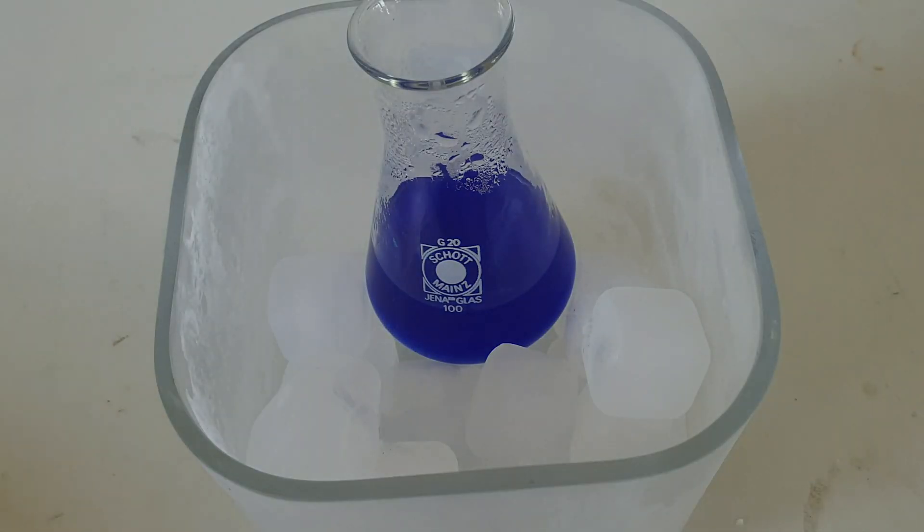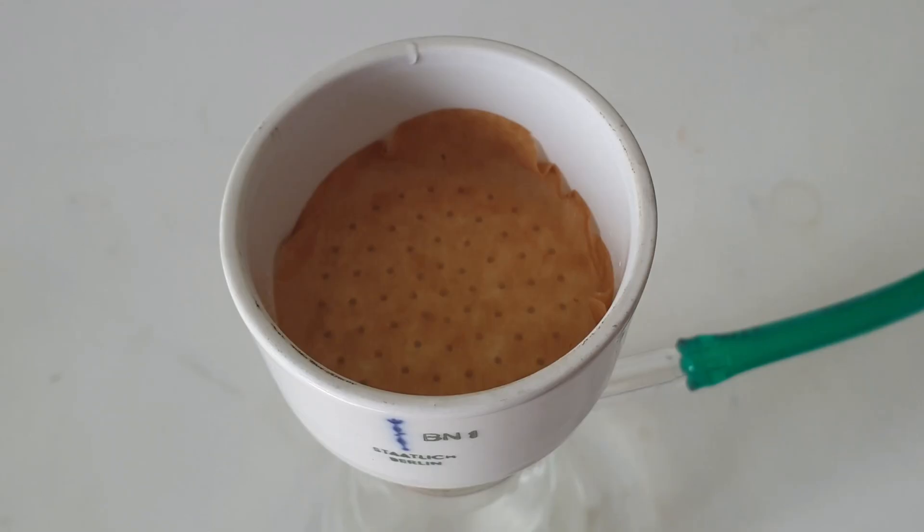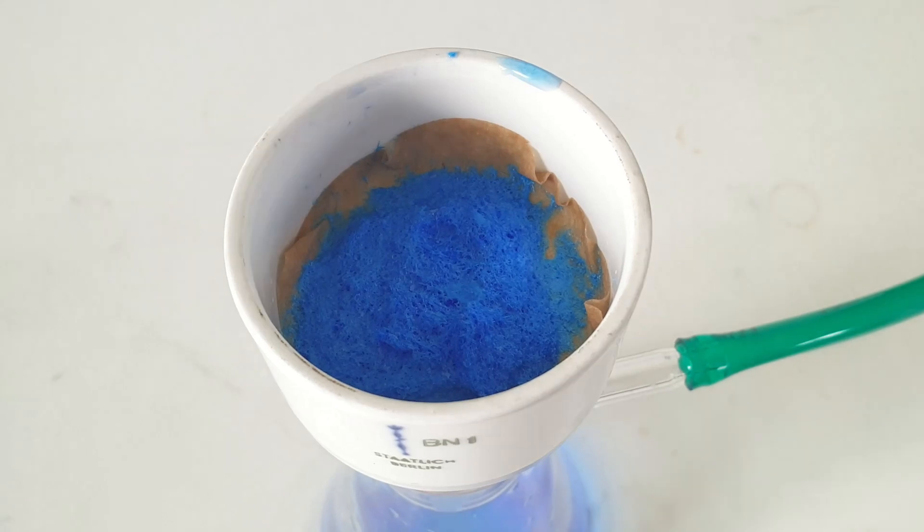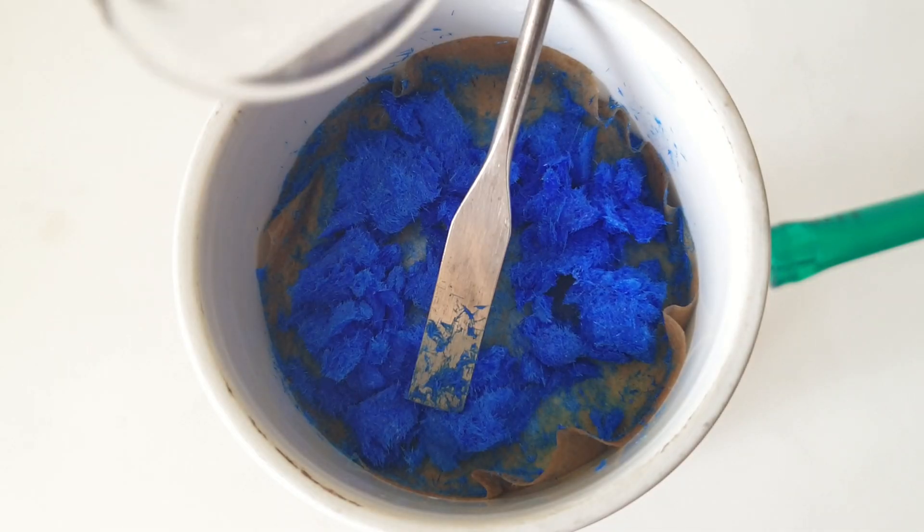I put the flask on some ice cubes to crystallize more product and then filtered the crystals. I washed them with some water and then with 50 mils of ethanol.